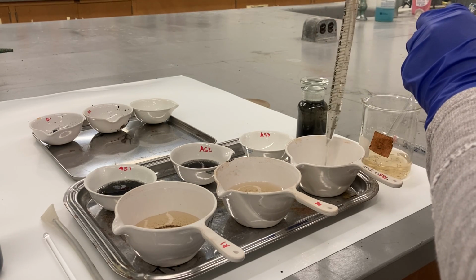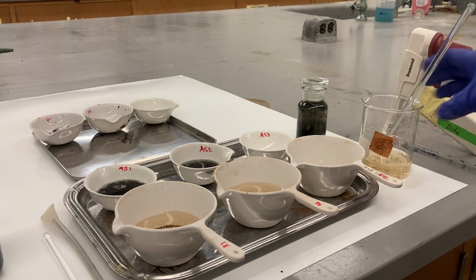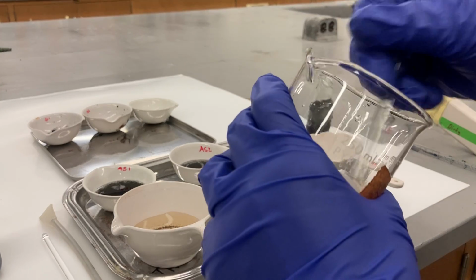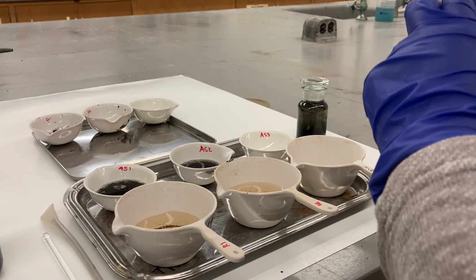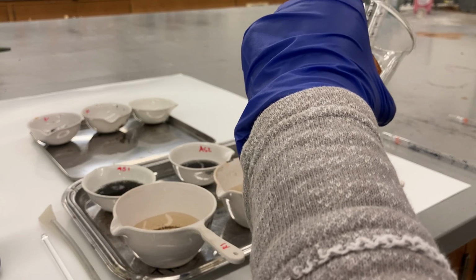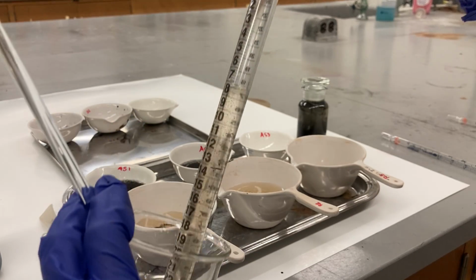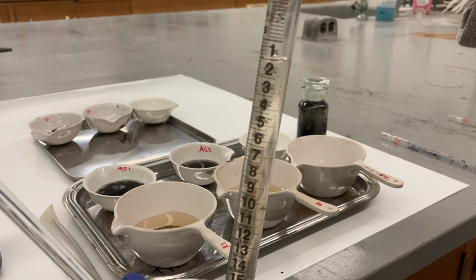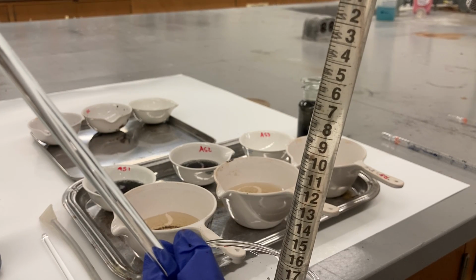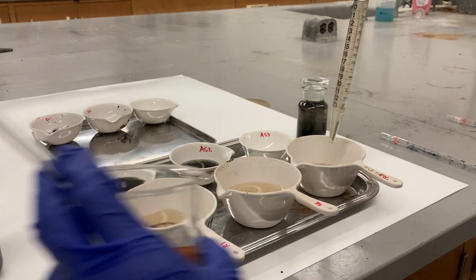This one, 25. It's pretty much like rain, with a lot of leaves in there. We call it runoff. This is just rain. Mix it, and then we need another 25. Sorry, need another 25. You have to go to 0 here. Then you put it here. So this one is done.